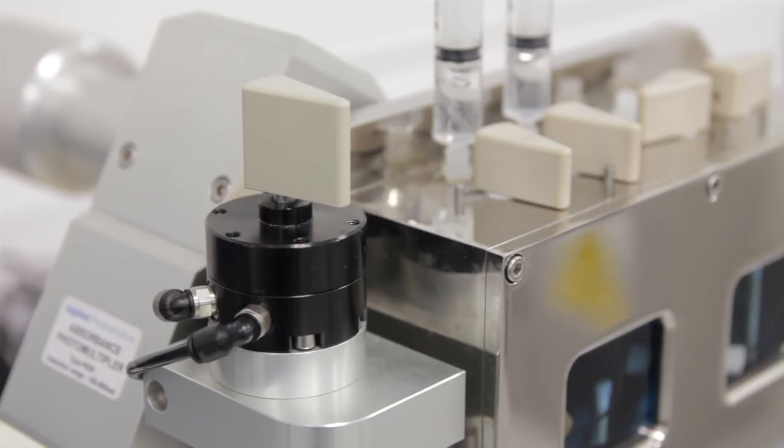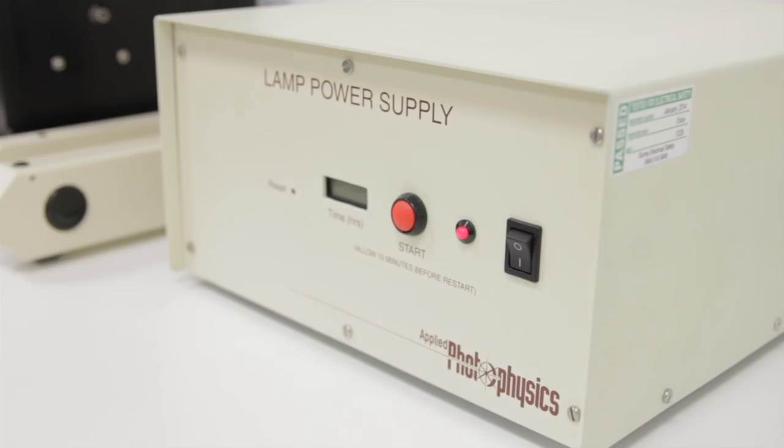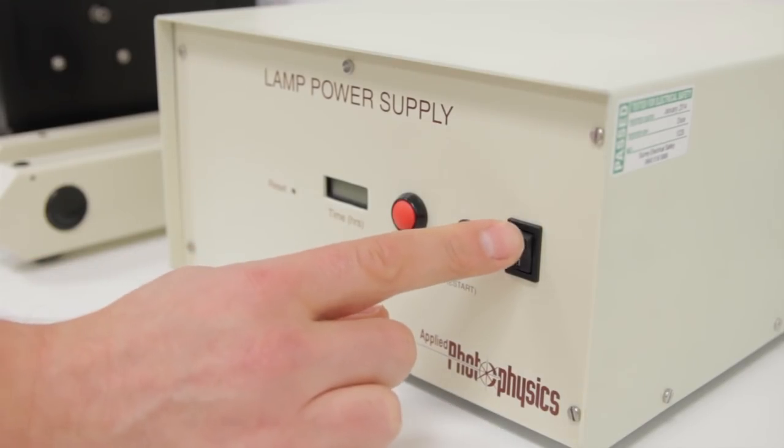Also shut down the software, switch off the electronics rack, and make sure you turn off the lamp. You may also want to switch off the gas supply at this point.